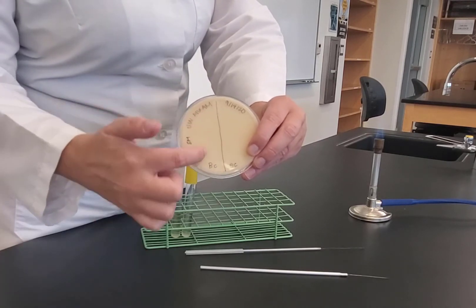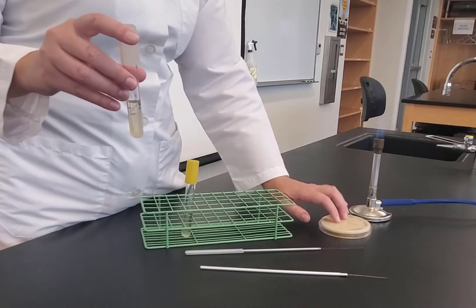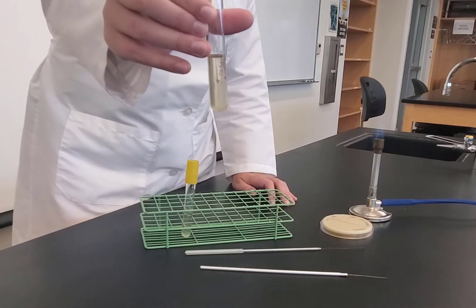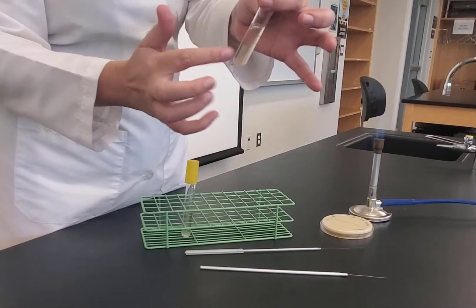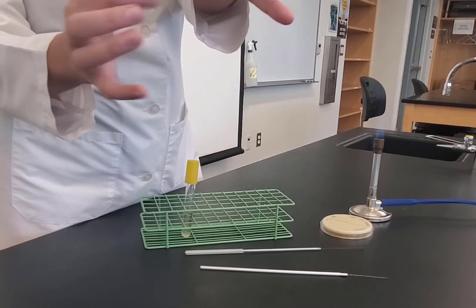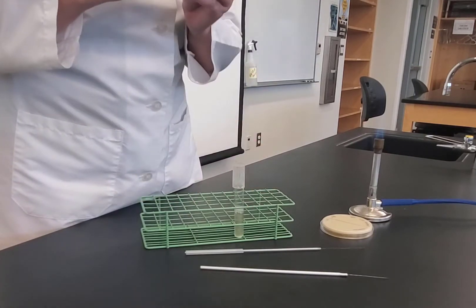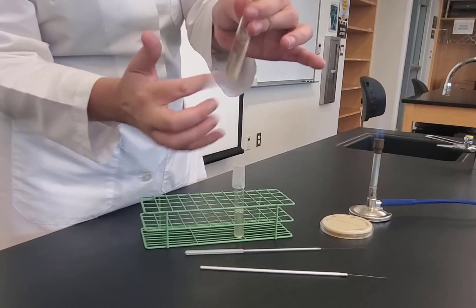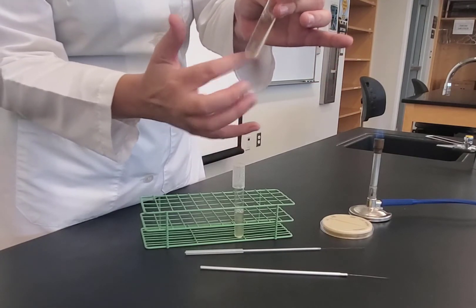The inoculation is one broad streak per organism, just like starch hydrolysis. The bacteria start in broth. Place the plate near the Bunsen burner — that's your sterile field. Notice the bacteria settle to the bottom of the tube, so before beginning, vortex to distribute the cells evenly. I like to vortex before I have anything in my hands so I can be more vigorous.